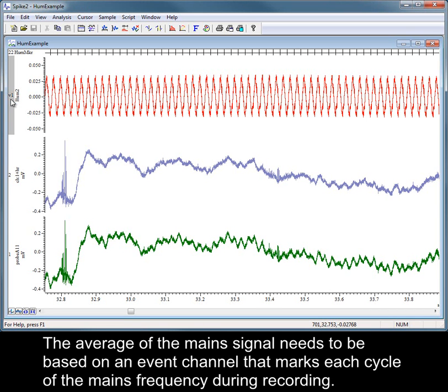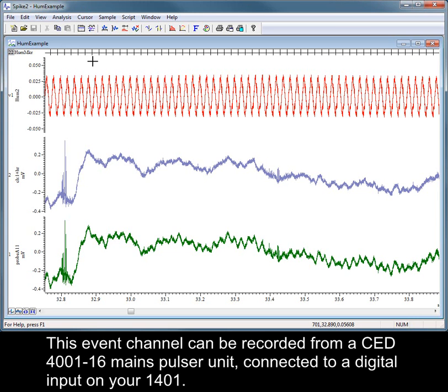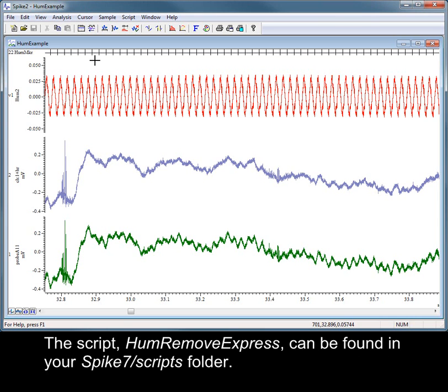The average of the mains signal needs to be based on an event channel that marks each cycle of the mains frequency during recording. This event channel can be recorded from a CED 4001-16 mains pulser unit connected to a digital input on your 1401. The script HumRemoveExpress can be found in your Spike7 scripts folder.